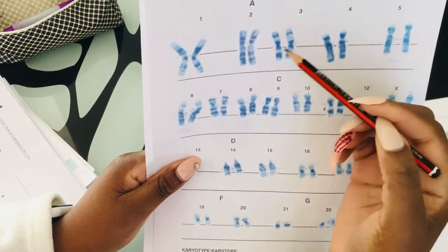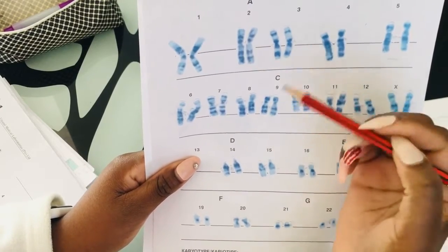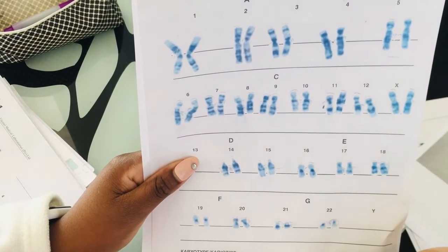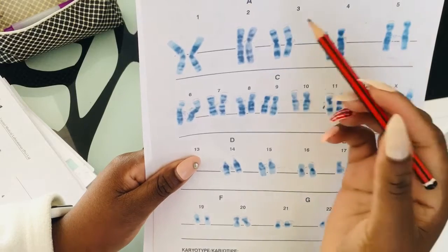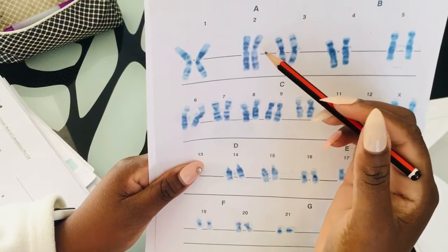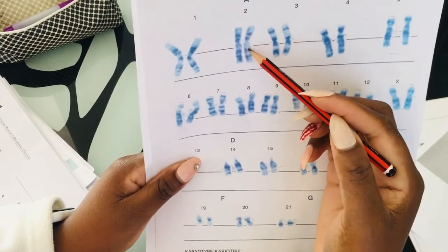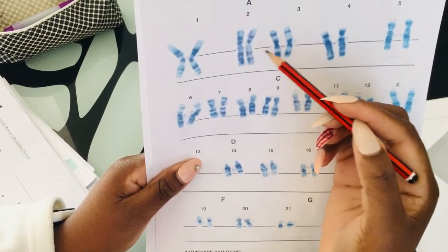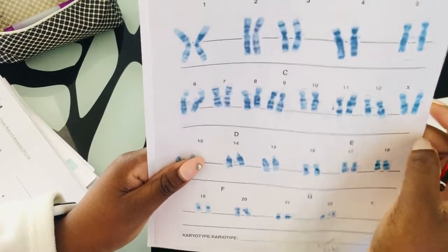So moving to your chromosome 2, it's gonna be your second longest chromosome that you will have in a setup like I showed you previously, like in a metaphase. So your chromosome 2 will have lots of bands, you see, but remember there will be this clear space here. But it's also, I think, submetacentric to me.